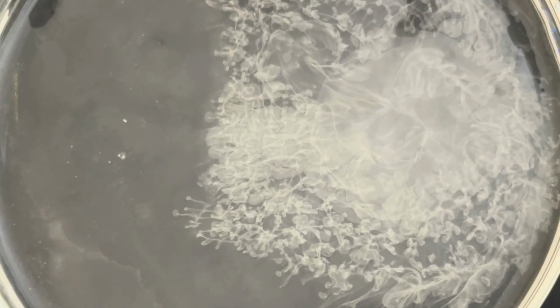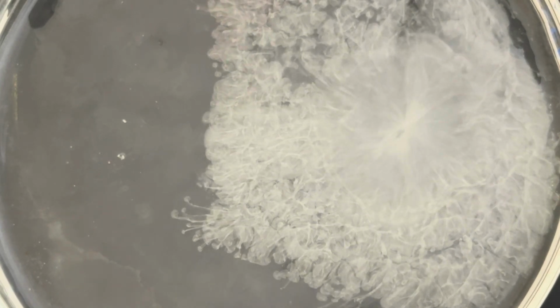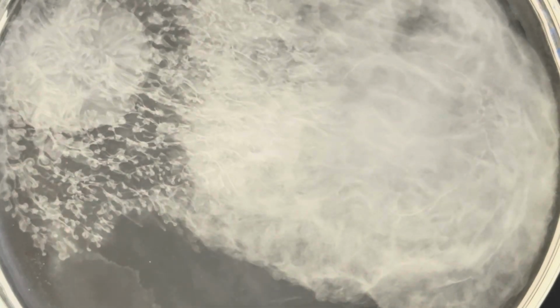Look at that. Just amazing. I'll add a drop over here. Look at that.